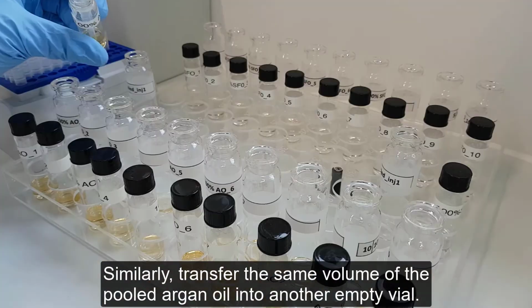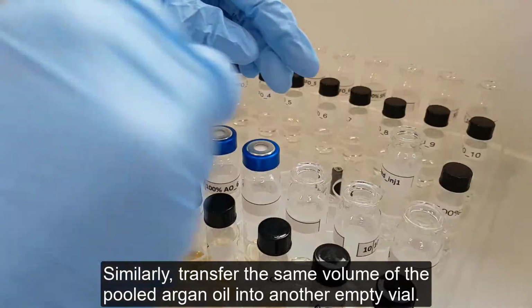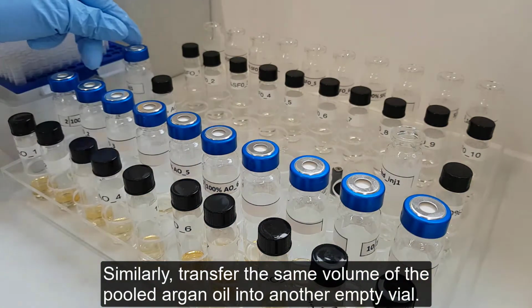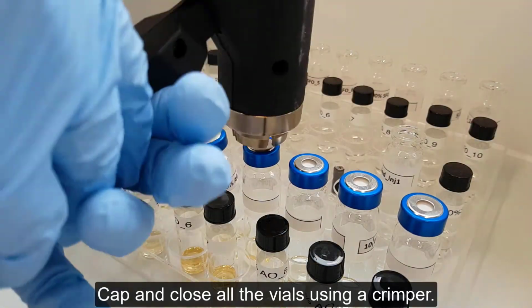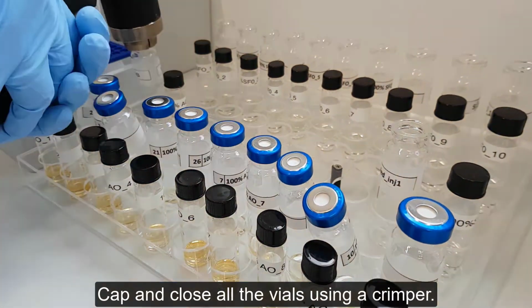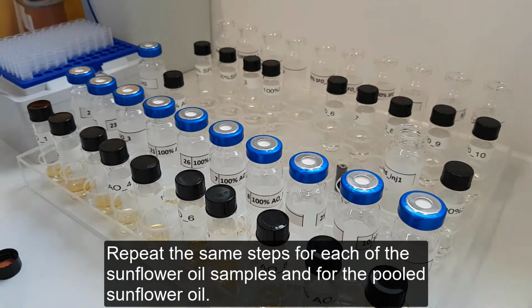Similarly, transfer the same volume of the pooled argan oil into another empty vial. Cap and close all the vials using a crimper. Repeat the same steps for each of the sunflower oil samples and for the pooled sunflower oil.